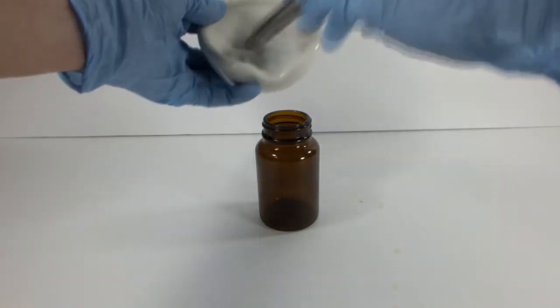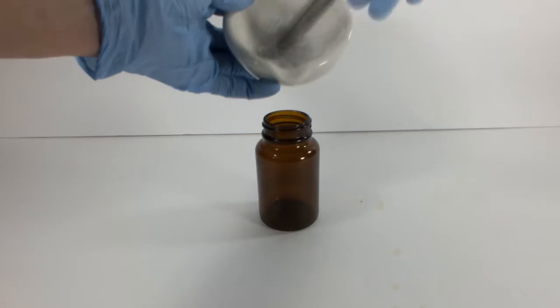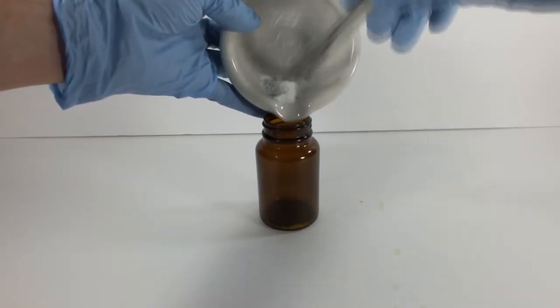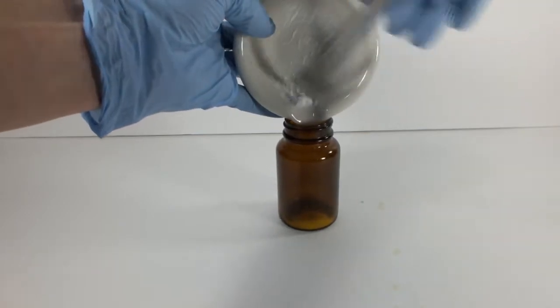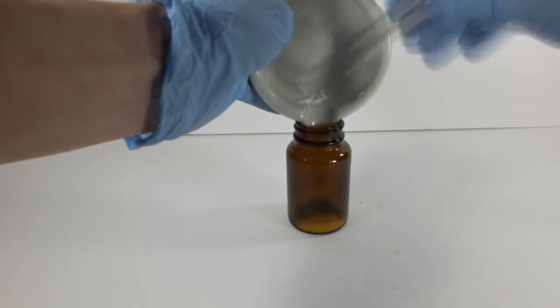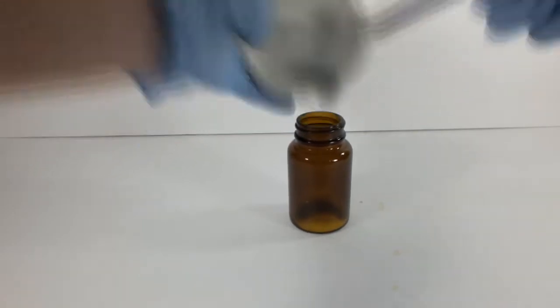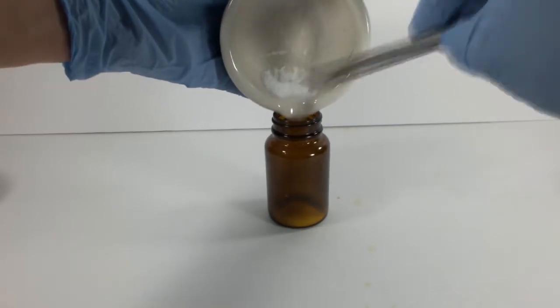This is another cool demonstration featuring this reaction. To prepare, I ground up some lead nitrate and potassium iodide separately, and they're going to be combined as solids in this little glass jar. I've sped this part up because it honestly took way too long for me to get the lead nitrate into the jar. It would have been a good time for a funnel, but I was trying to minimize the things contaminated with lead. The potassium iodide went a lot easier.